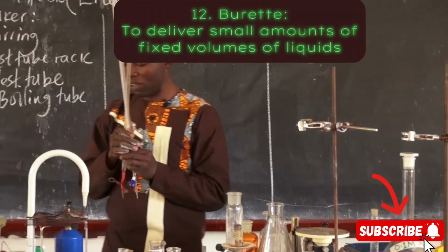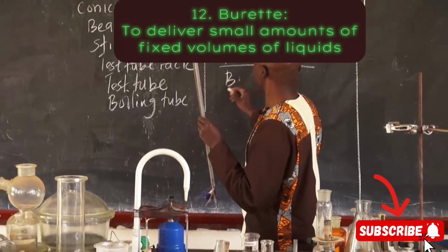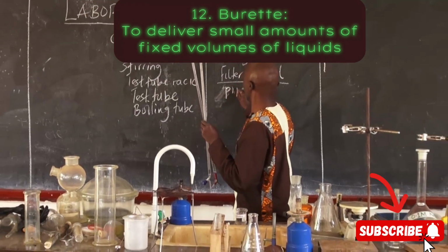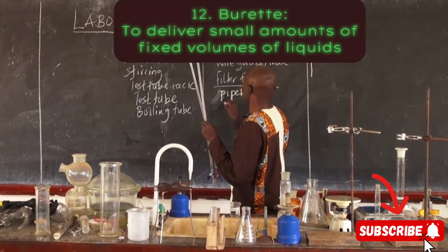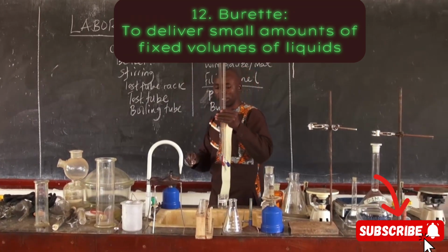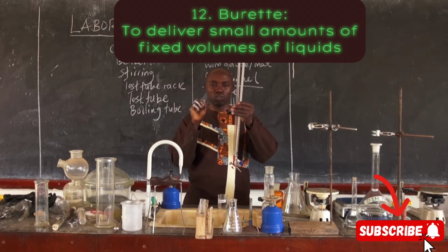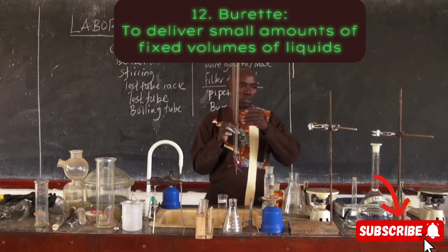With me I have another one called a burette. Burette, so we got a pipette first. Then I also have what we call a burette. Now burettes are normally used to deliver liquids in required small amounts.